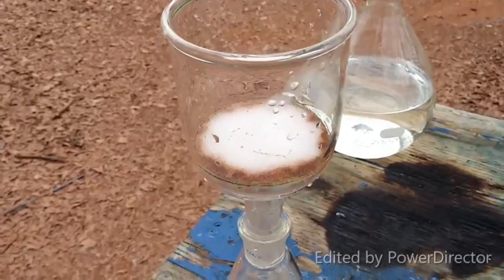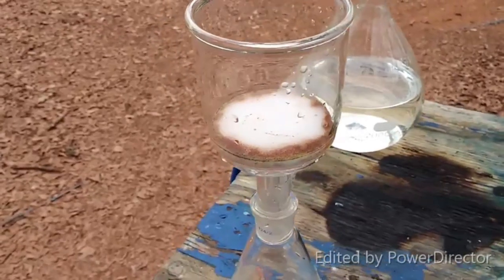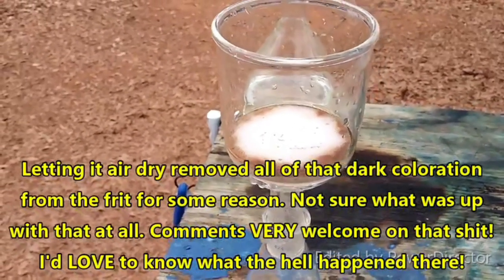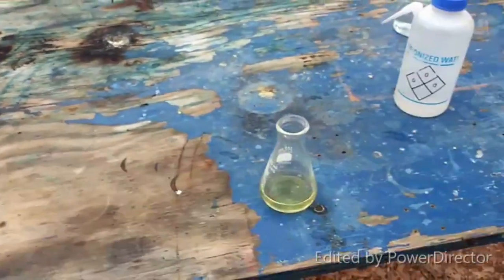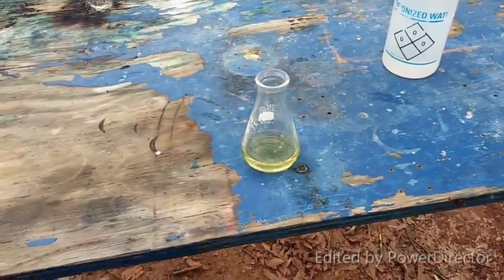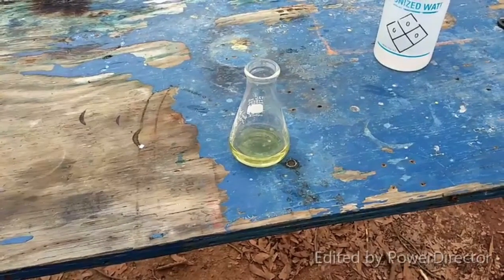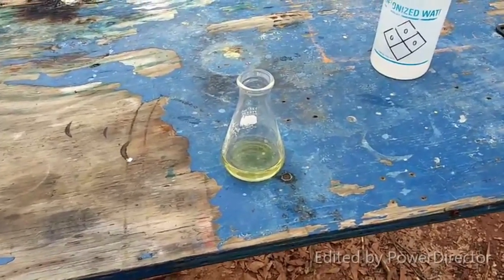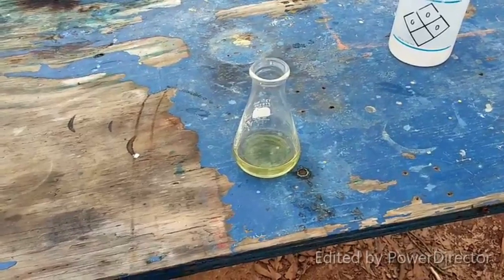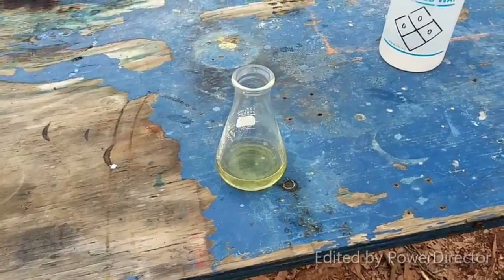And then I cleaned up, and this is clean compared to what it was before, with concentrated hydrochloric acid. I'm gonna have to soak this in acid in order to clean all that out. So yeah, honestly, if I was gonna do this again, I wouldn't even bother trying to filter it at all. I would centrifuge it, all of it, every bit of it. Just wash the solid material that you get from that with some water, and then use that to create your slurry that you then add the potassium cyanide solution to, in order to get your final potassium tetracyanonickelate. Man, what a mess.